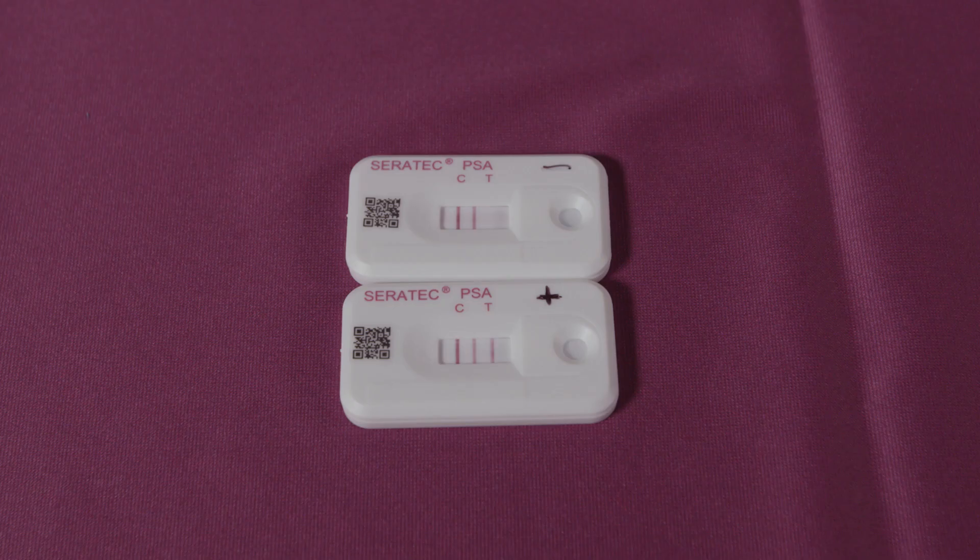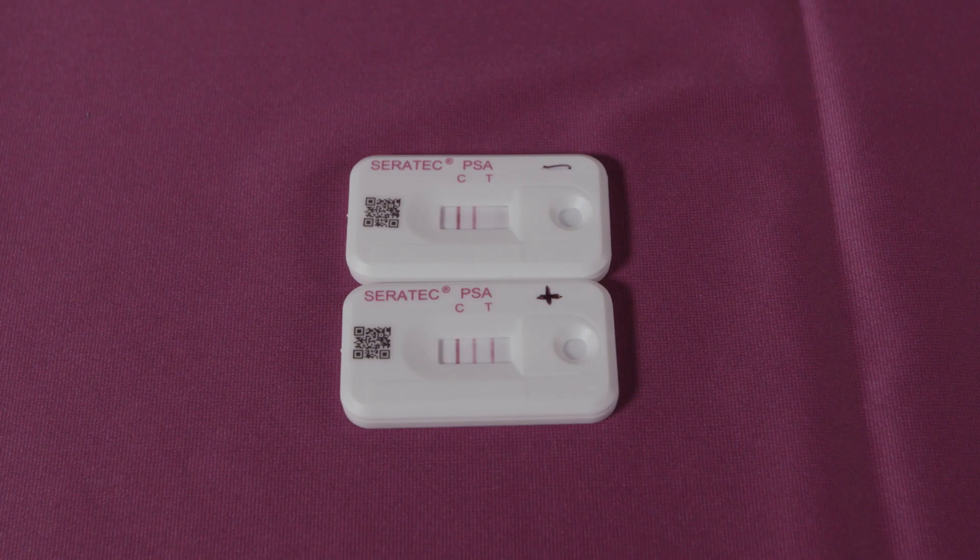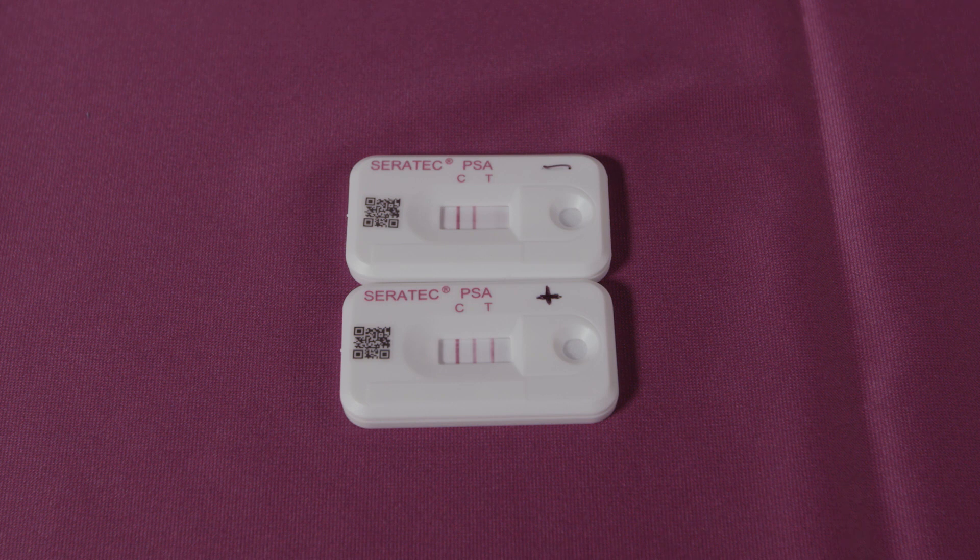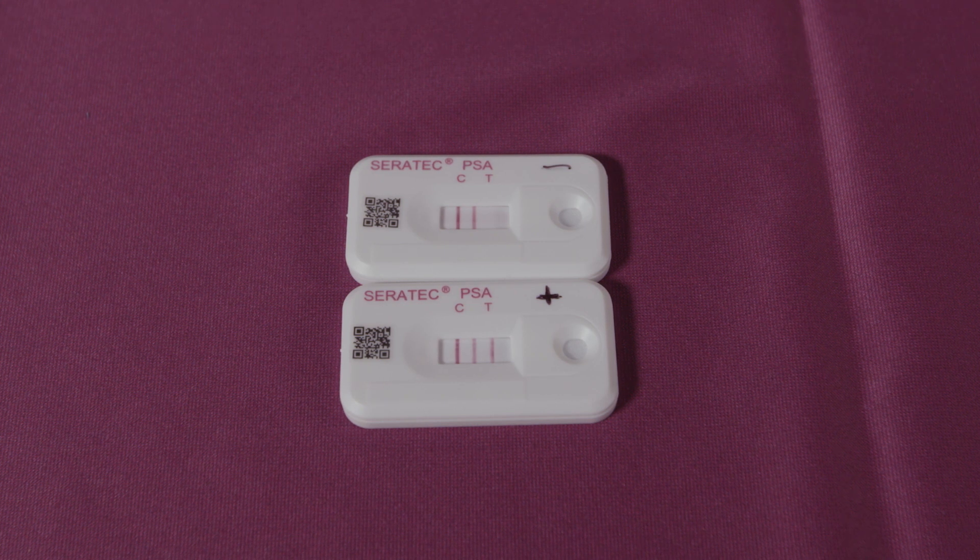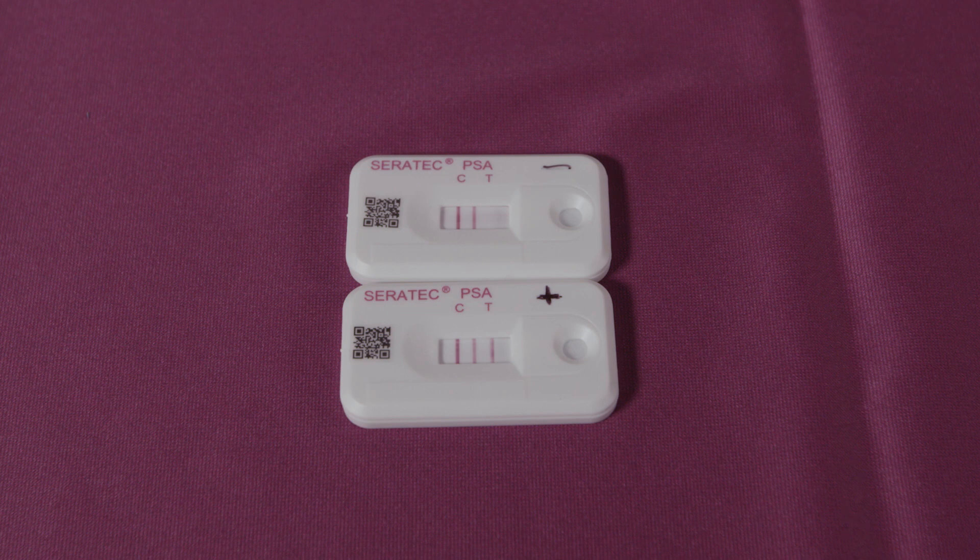Read the results after 10 minutes. Allow the membrane to incubate the full 10 minutes to call a negative result. Photograph the results. Positive membranes may be retained to demonstrate results.